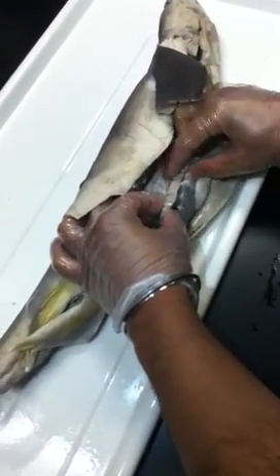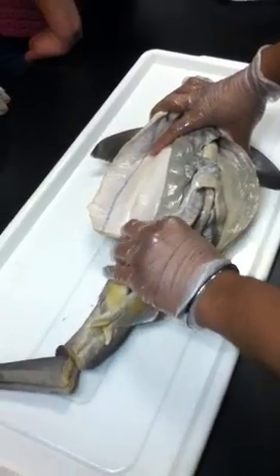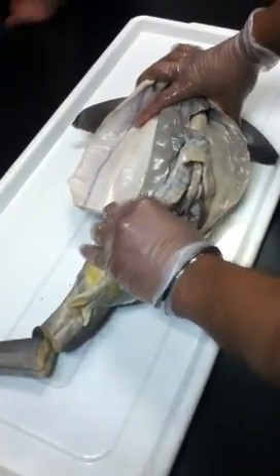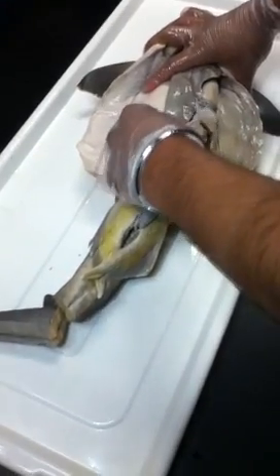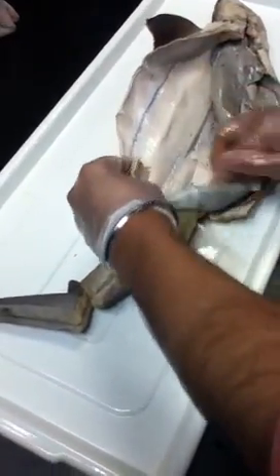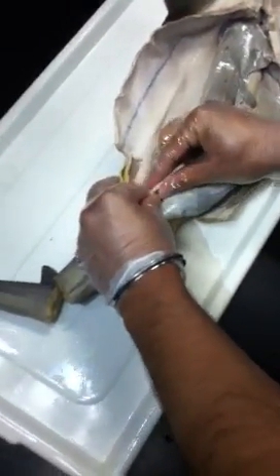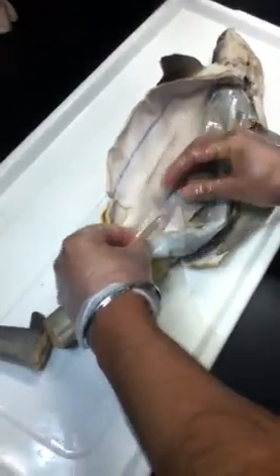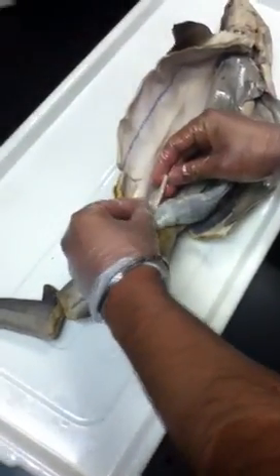All right. And then again, the distinction between duodenum, ileum, and rectum, that's really the major components of the intestines here. Where the duodenum becomes the ileum, I'm not going to be that particular, but the rectum is going to be the very, very end. Show them the rectum, because you saw where it empties into the cloaca, right? So this is the rectal gland right over here. Not the rectal gland, just the rectum itself. Okay, you can show them the gland. That's the gland. There we go. That's not a structure that I put on the sheet, but it's nice and conspicuous.